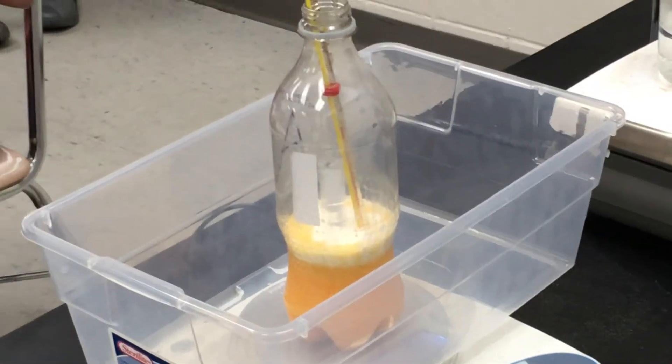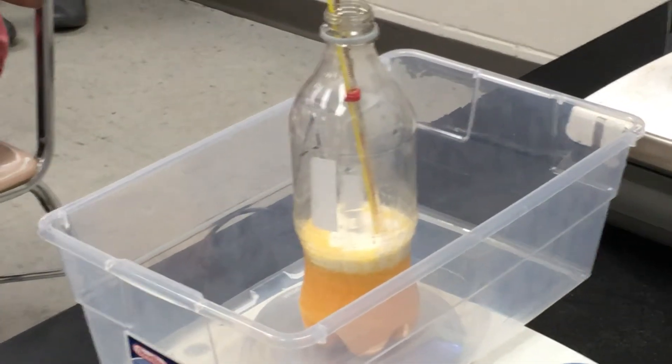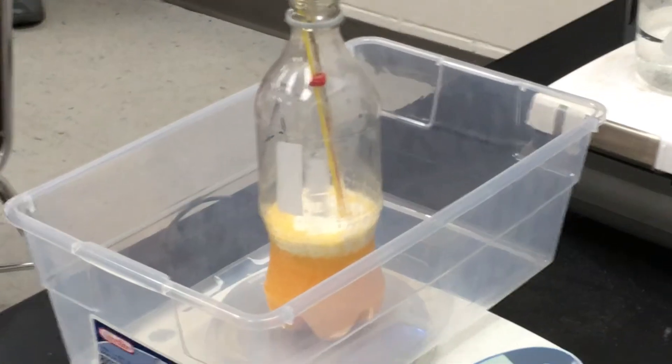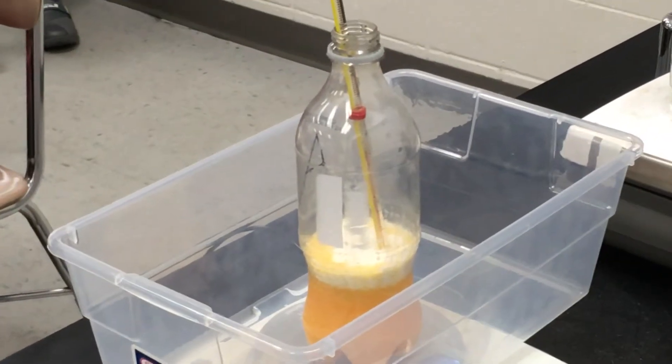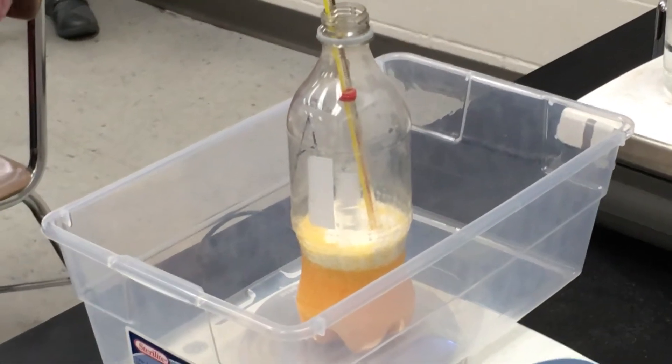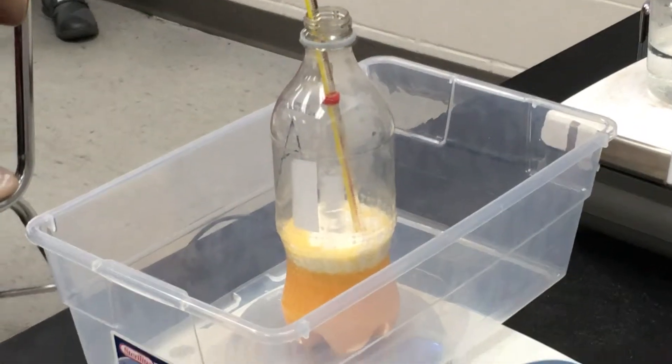So I added my solution in, it jumped up to 251. Keep going.